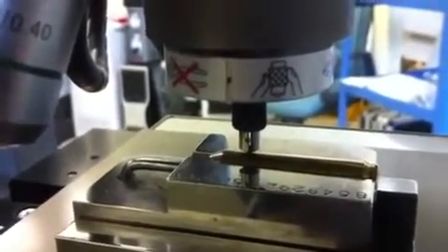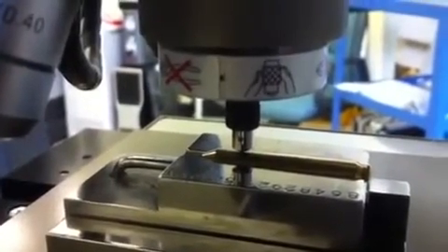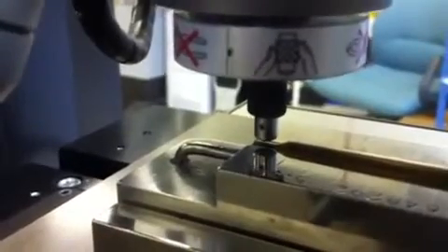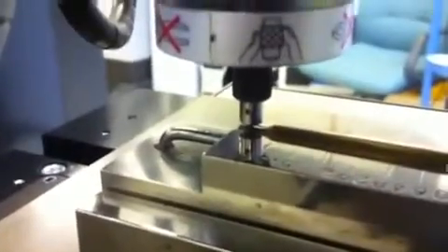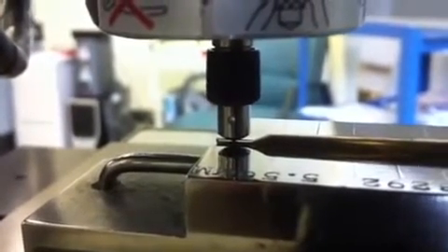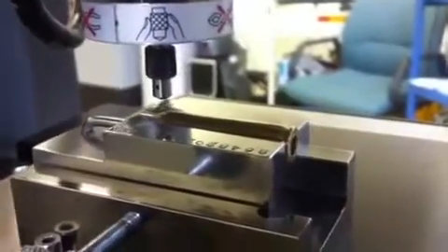For the Z-axis recognition portion of this test program, the 2500 will actually recognize the change in height based on my program control. I just told it that this last indent is at a different height, and you can see that we have that necking portion change in height — moving over to the necking portion of the bullet shell. All five of our indentations have been completed, and our stage will now navigate back to its first indentation location.